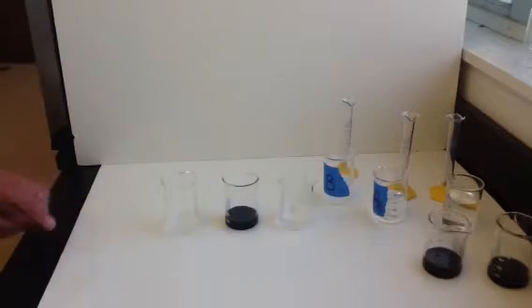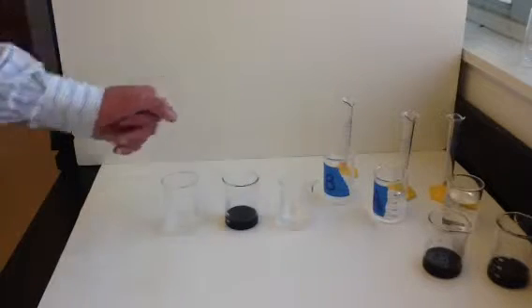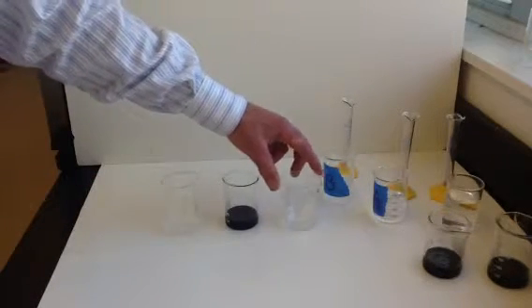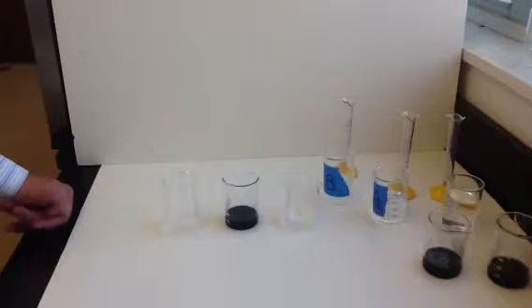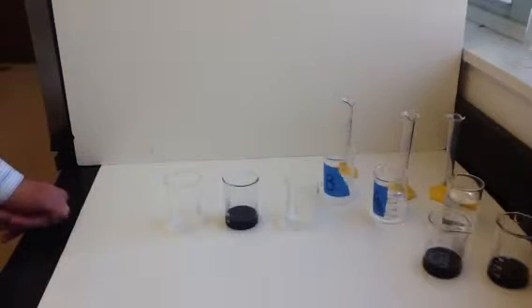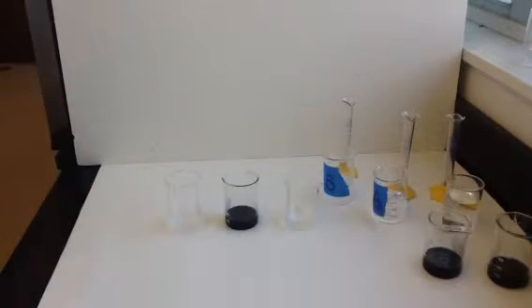So this was our hot one. This was 40 degrees. It was 10 milliliters of A and 10 milliliters of B. So you can compare that to the first trial that we did, where we had each one at 19 degrees Celsius, which is room temperature today. This right here is our third trial. This was the lowest concentration of A. So this one's taking a little bit longer because the concentration of A is low. It was only 3 milliliters of A. And then over here we have our cold one. The cold one was the same concentration as the warm one. It was 10 milliliters of A, 10 milliliters of B. And just the temperature was varied in this, our 5th trial.